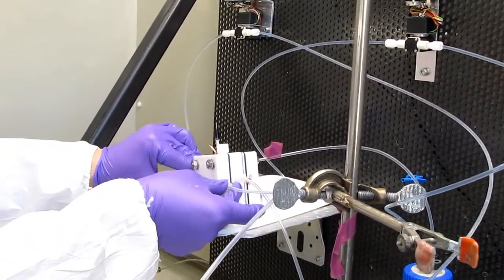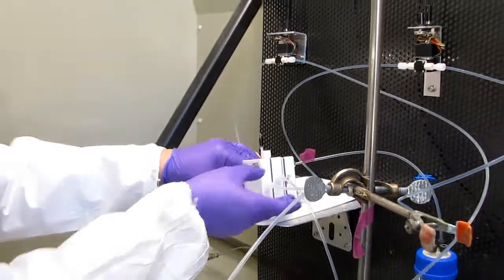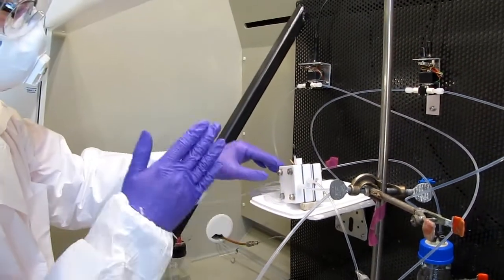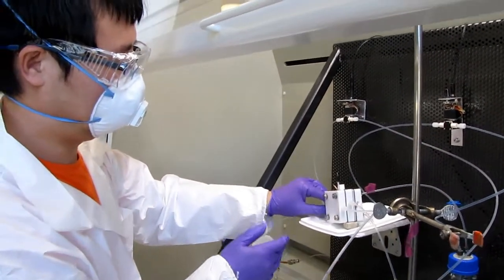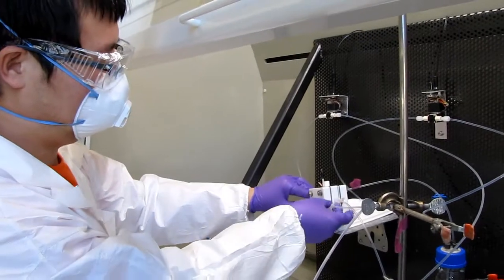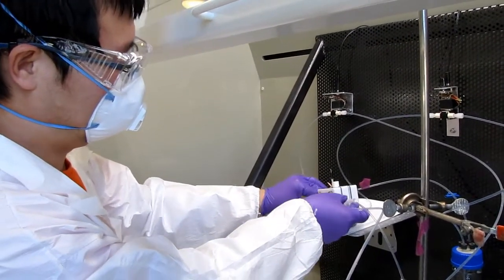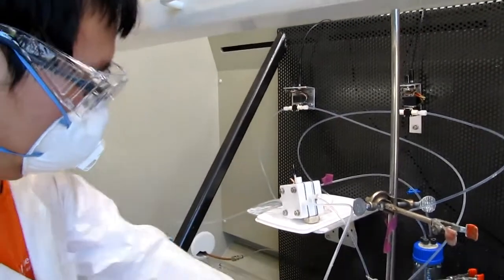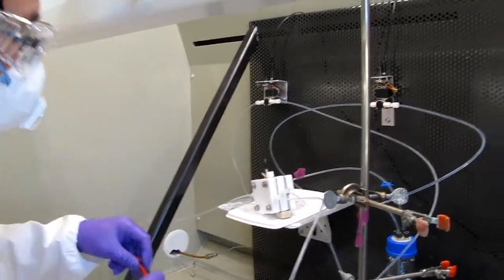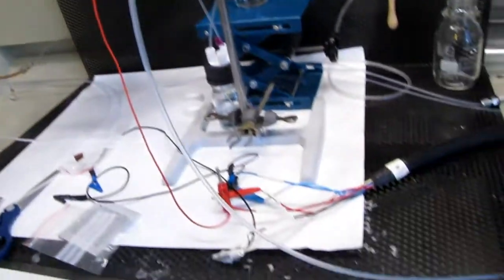Because your GDE is hydrophobic, once you apply electricity, it will become hydrophilic. So you see this is the CO2 line that you just... yeah, this CO2 line.